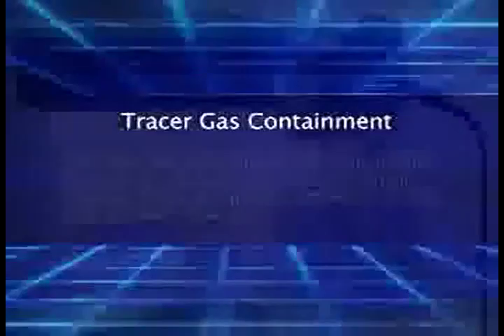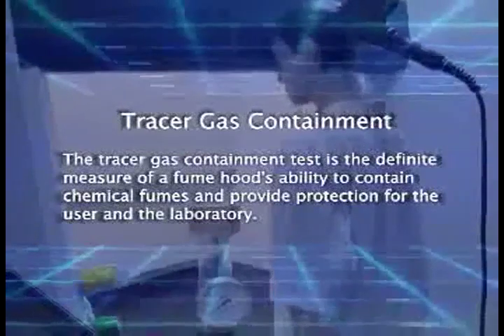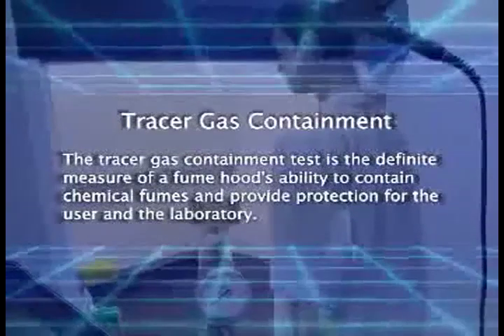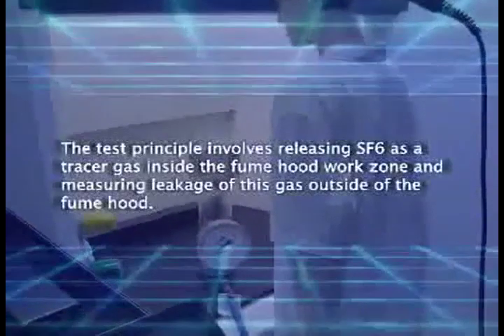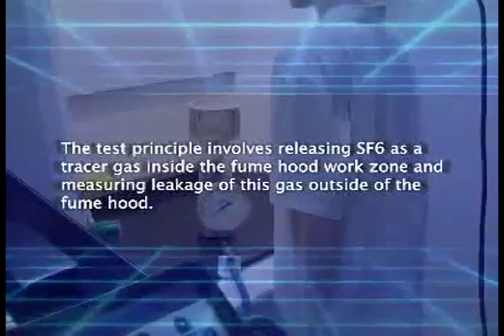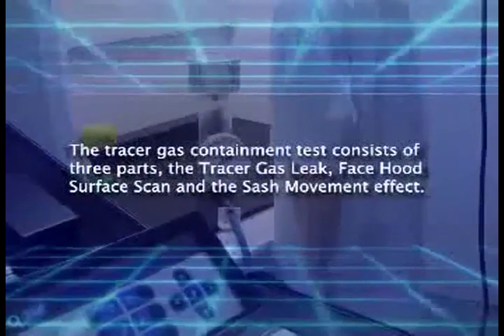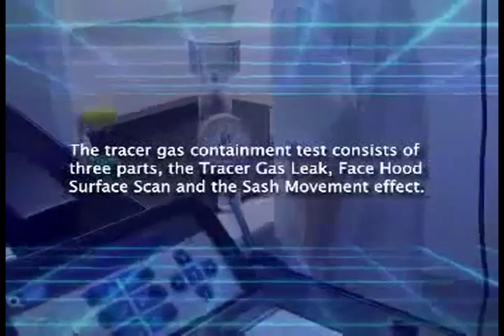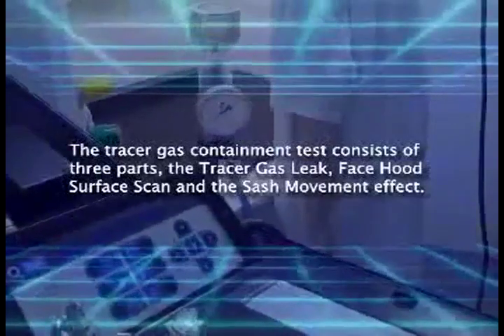The tracer gas containment test is the definitive test of a fume hood's capability to protect its user and the laboratory environment. SF6 gas is released inside the work zone as a tracer gas, and leakage is measured to ascertain the effectiveness of the hood. The test consists of three parts: tracer gas leak, face hood surface scan, and sash movement effect.